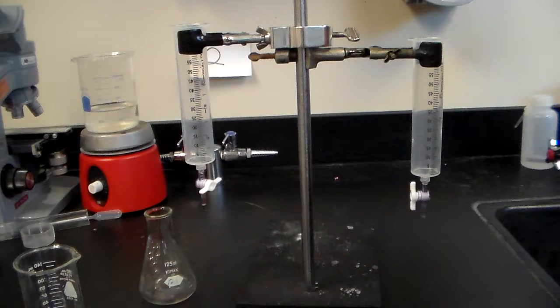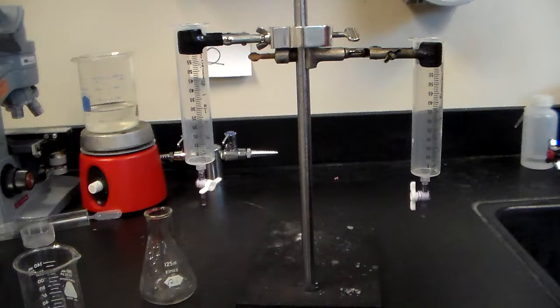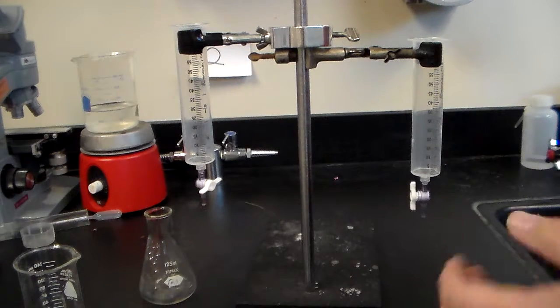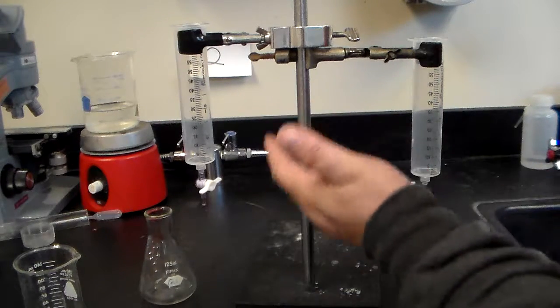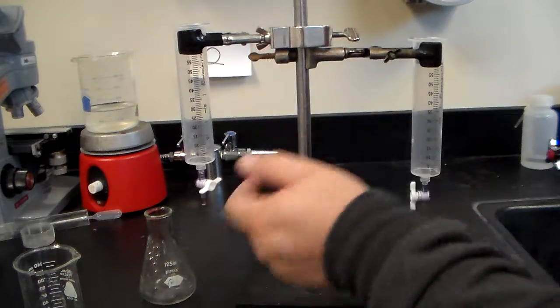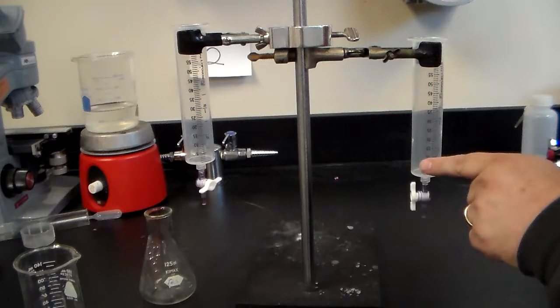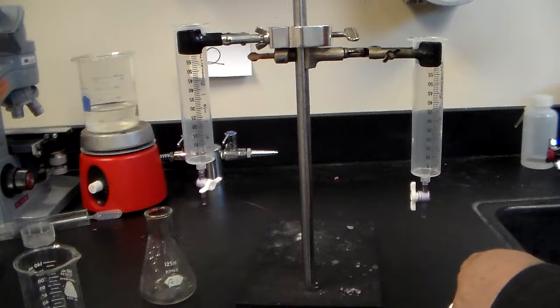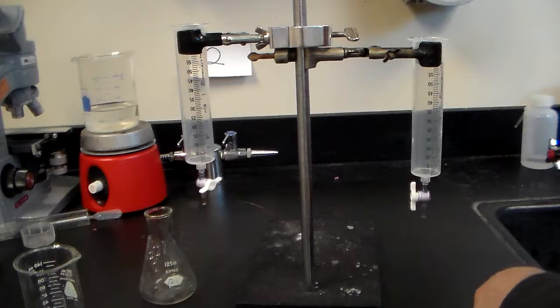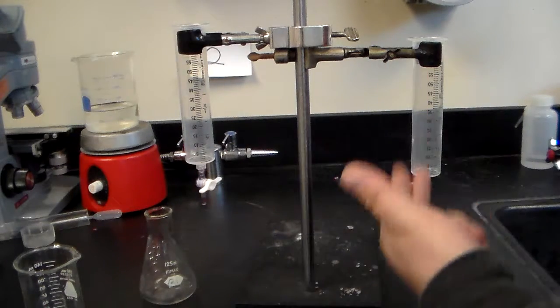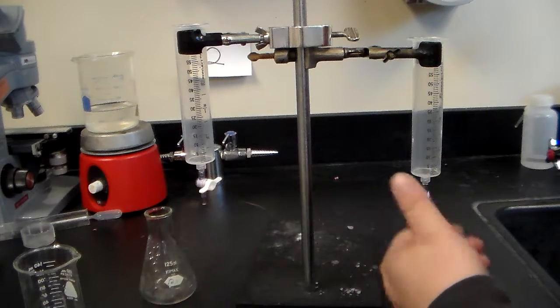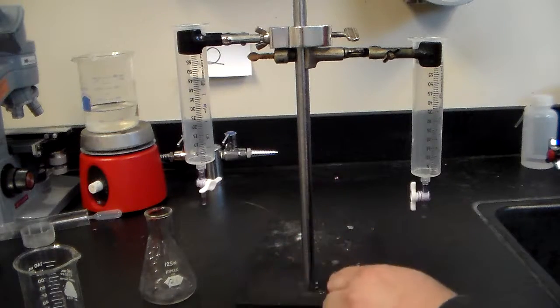For what we're doing today, we're doing a time-honored technique called titration. What equipment are we going to be needing? We'll have a ring stand, two clamps, and these are called burettes. You can look at burettes as dispensers. One side is going to be the acid, the other side is going to be the base.